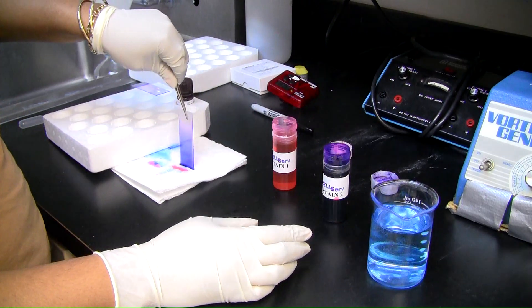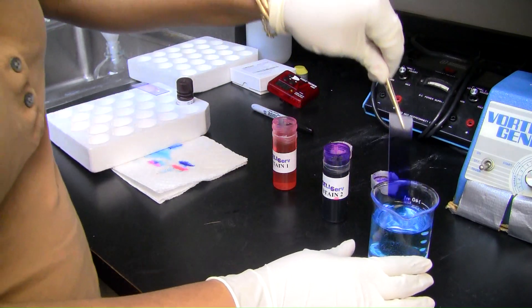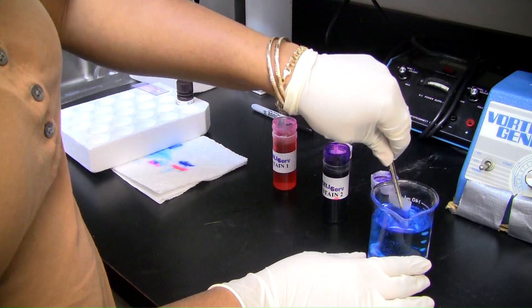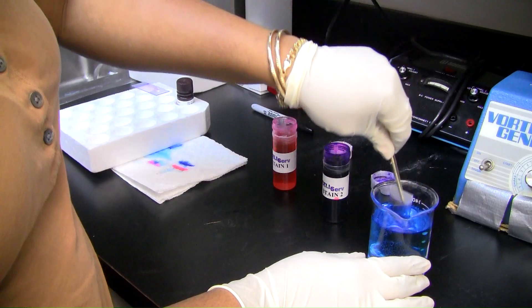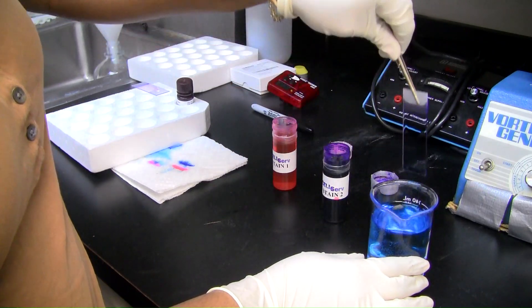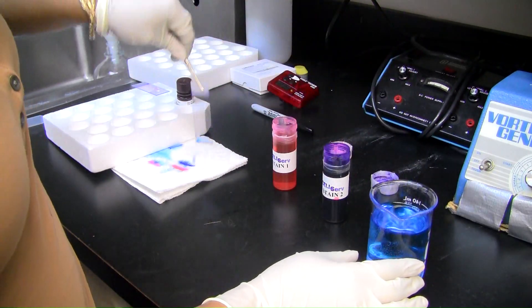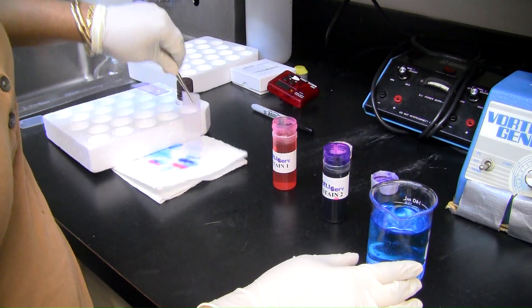Finally, dip the slide in distilled water three to five times. Allow the slide to air dry for five minutes before observing under the microscope.